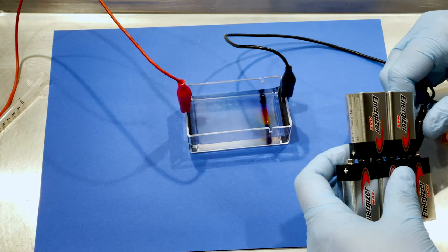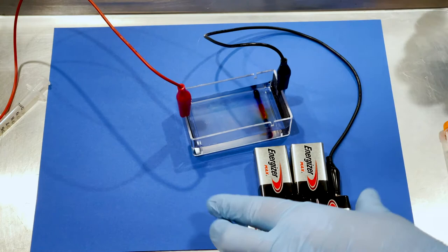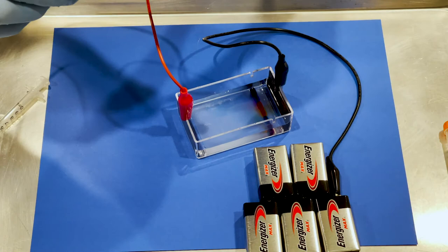Then I'm connecting the electrodes to the batteries following the instructions. The black electrode connects to the negative terminal of the battery and the red electrode connects to the positive terminal of the other battery. Electricity will be flowing through the gel.